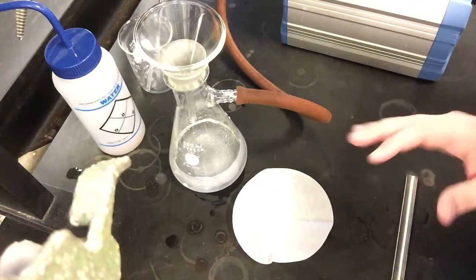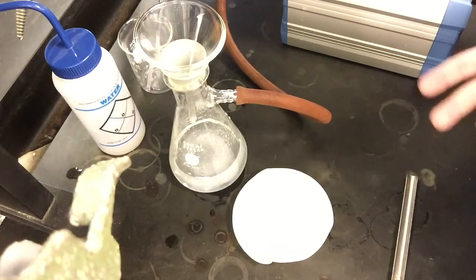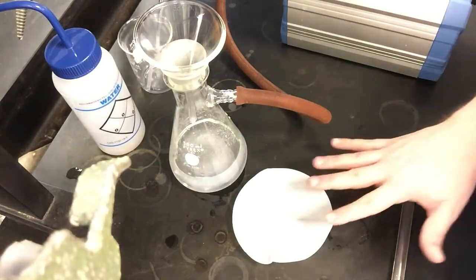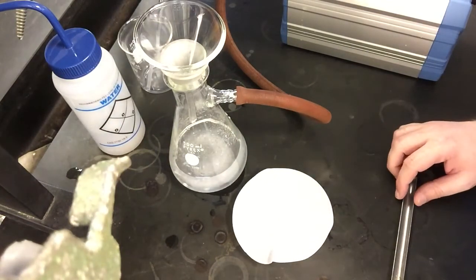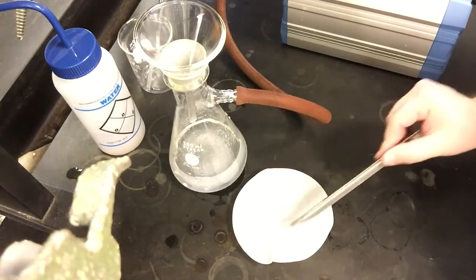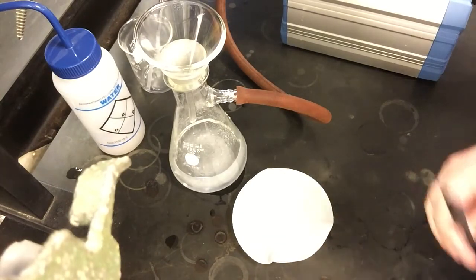What I'm going to do now is take our sample and put it in an oven for about 15 minutes, maybe a little less, maybe 10 to 15, and just let it dry. After that, hopefully all of the water that's still stuck either in our sample or in the filter paper itself will have a chance to evaporate, because the oven's a little over 100 degrees Celsius. We get the water to evaporate but not decompose our final compound. Then we can hopefully get a reasonably accurate final mass for how much product we've isolated here.